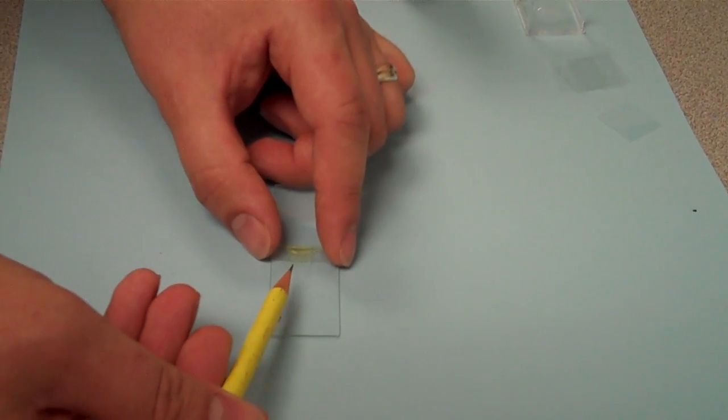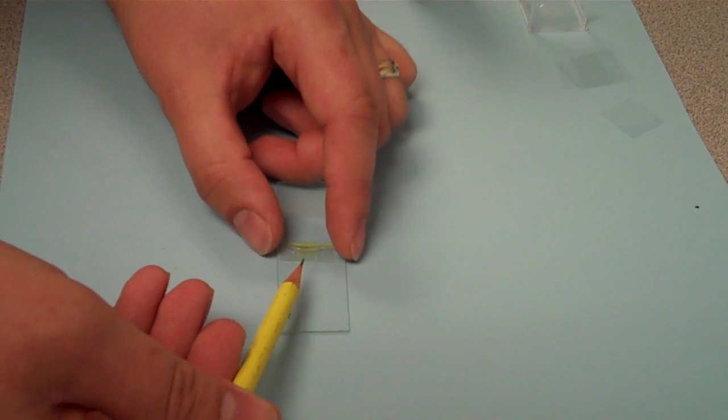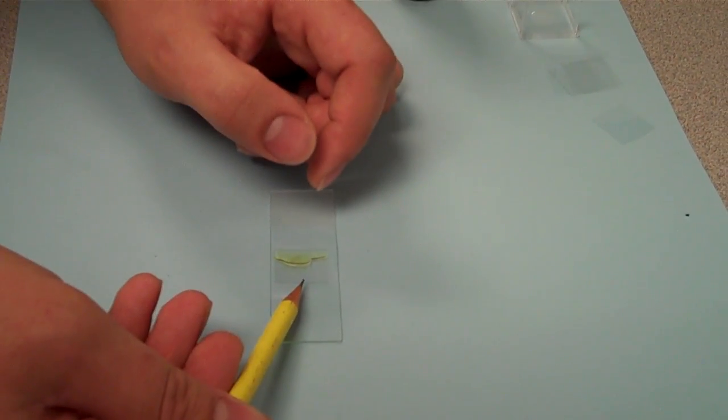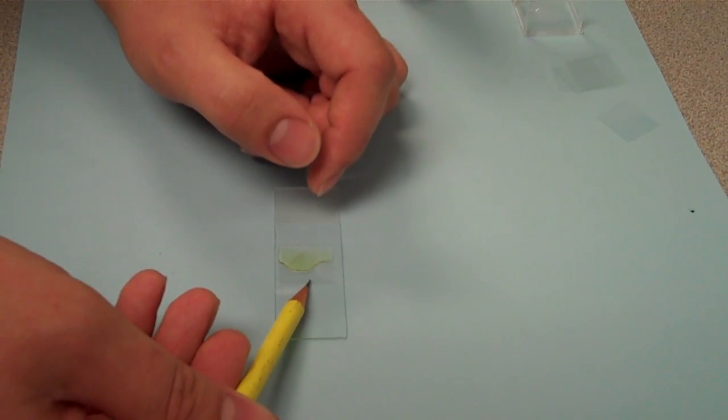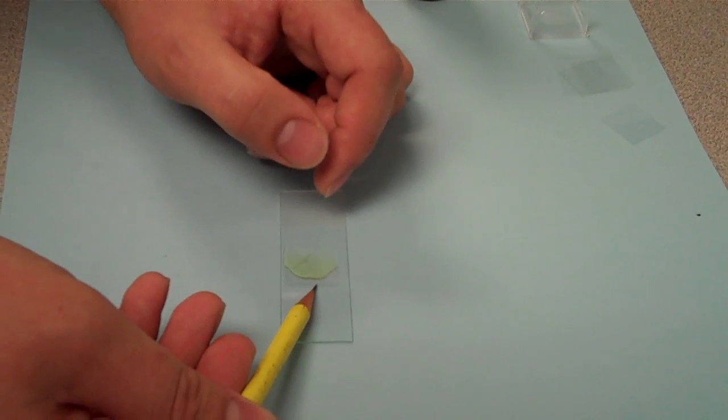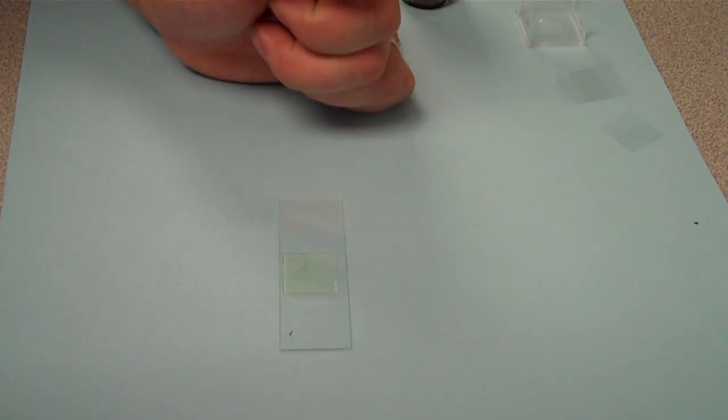Take a really sharp pencil, and hold up the other end. And if you lower it really slowly, you'll get it down without any air bubbles. Just like that.